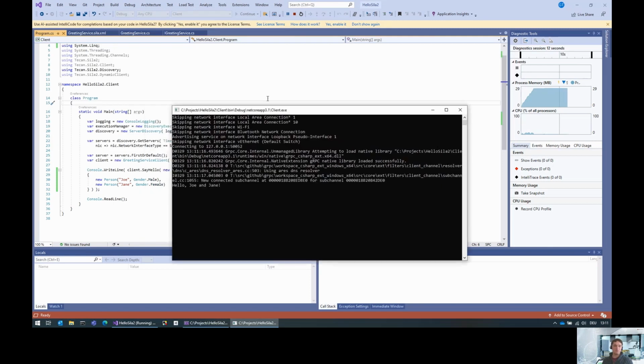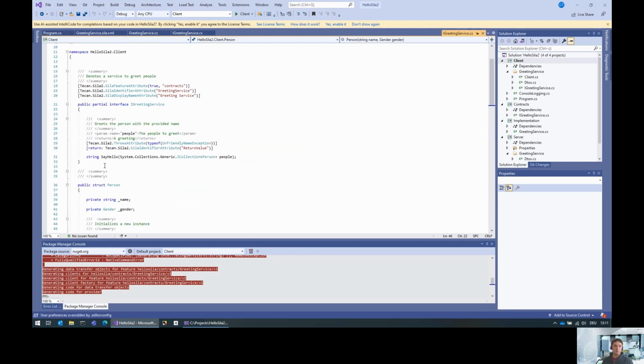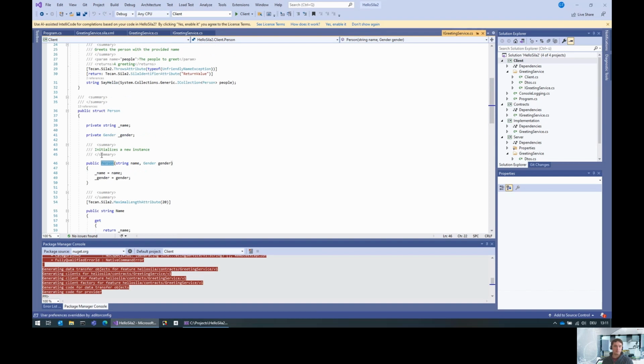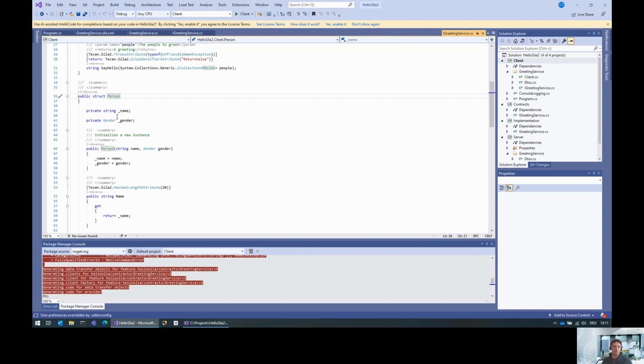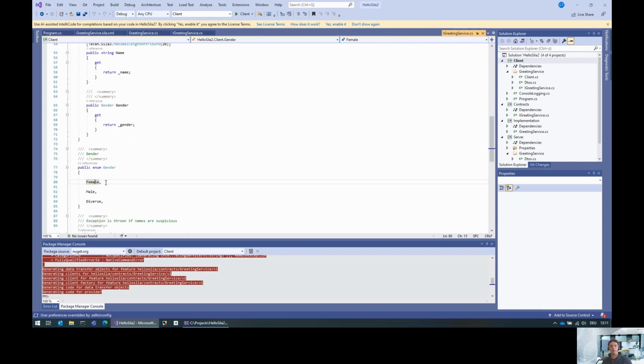Please note that the person class that we created here is actually the generated code in the client. The code generator takes the feature description and generates this person structure out of it. The gender is also an enumeration that has been generated from the feature description. So basically the custom types and also the enumerations are supported both at the client and at the server side.